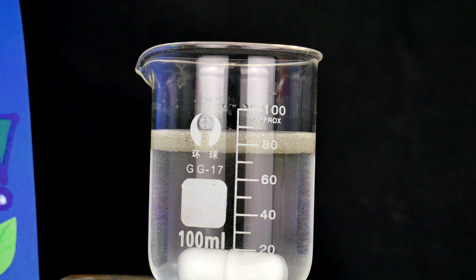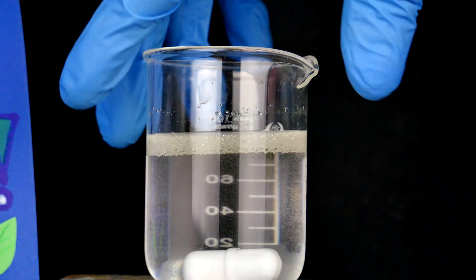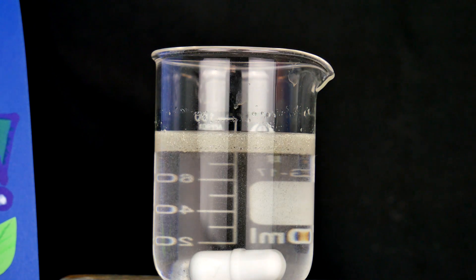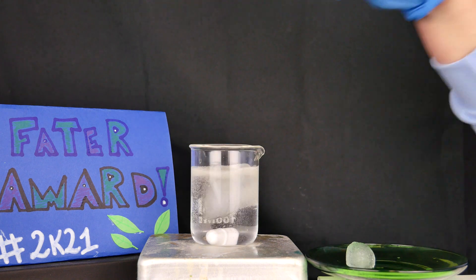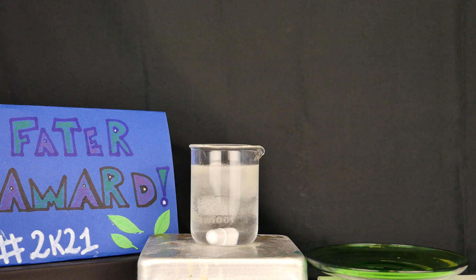At the end of the stirring, two distinct and separate layers of liquid are reformed. At this point we add ice to our mixture to bring it to low temperatures and show that our enzyme is active even in these conditions.